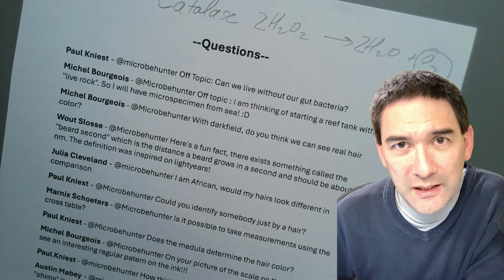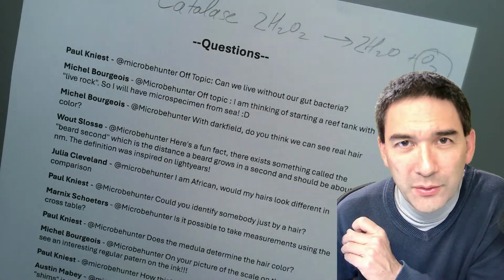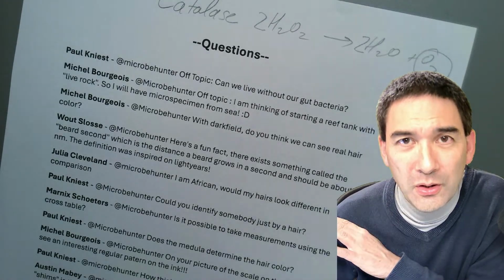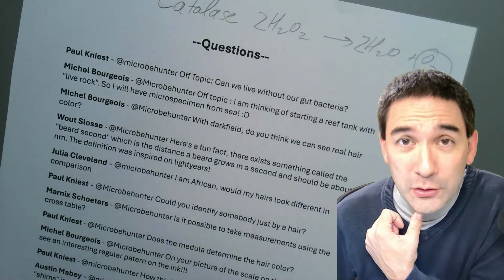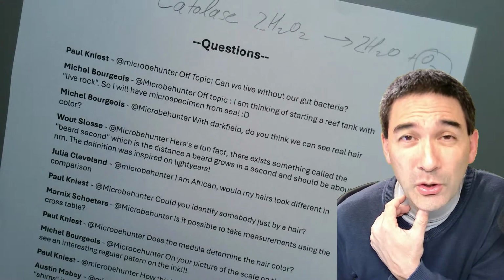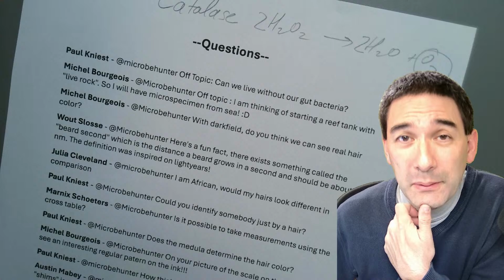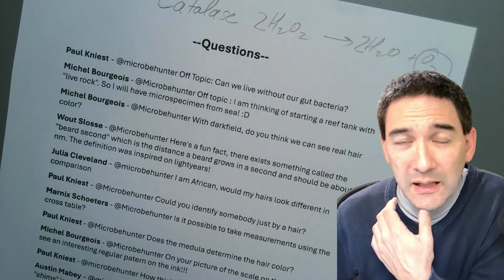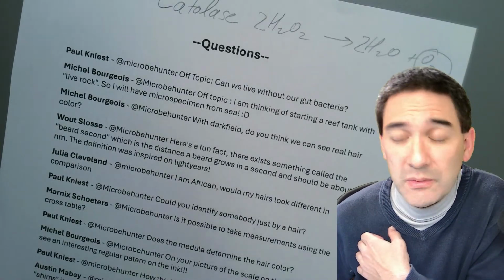If you're interested in mounting media, I don't have the link ready here, but I know that Microscopy UK, that's a pretty large website, has articles on mounting media, also recipes on how to make your own mounting media. I tried to make my own mounting media, but I have not been so successful because of the bubbles. You have to degas everything properly and so on. You need equipment. But essentially, polyvinyl alcohol and polyvinyl acetate, PVA, is a water-based mounting medium that has been used in the past quite a bit.